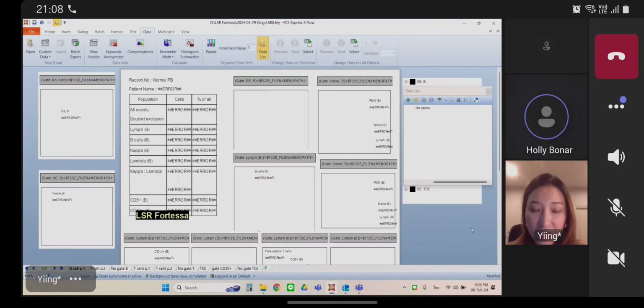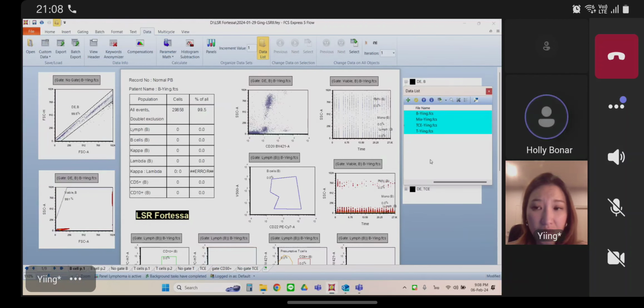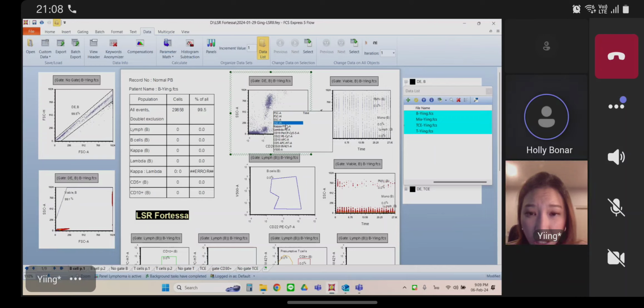Okay. And then go ahead and load your LSR data. And is this the data files you're sending me? What you're showing me? Is that what you sent me? Yeah. Okay. Now let's go to that same dot plot that we did in the other layout. Click on it, the one that says side scatter versus CD20. Yeah. See, so you only have 4 parameters up here. Remember, so in the FACSDiva one, you had 6 parameters. Yeah. So I think all of your parameters are shifted in this data.